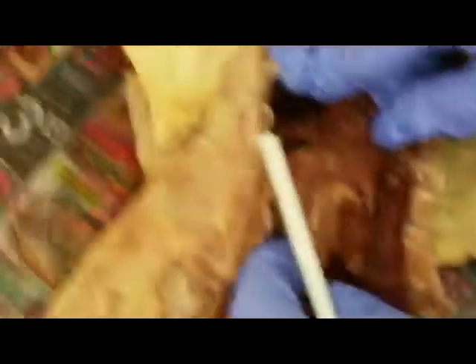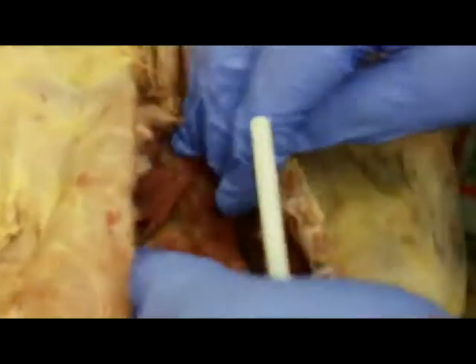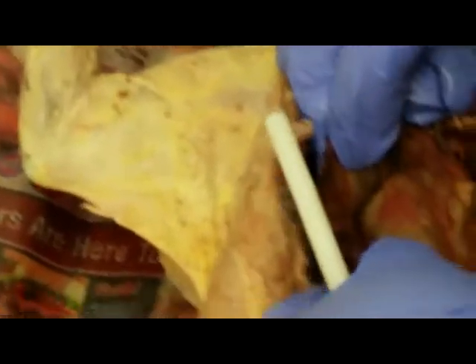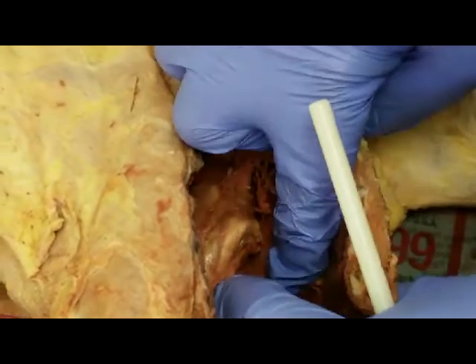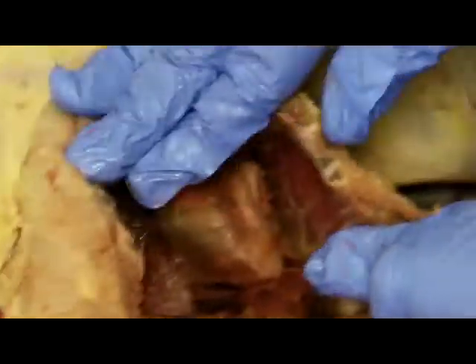And the cat also, here's the heart enclosed in the pericardium. Remember I said the pericardium is actually a bag that encloses the heart. We're not going to open it, but just to show you that the cat, here are the lungs. It has 7 lobes. So here you have the superior lobe, middle lobe, and inferior. And on the other side you also have superior, middle, and inferior. And then you have in the middle, down here, is the mediastinal lobe. So those are the lobes.